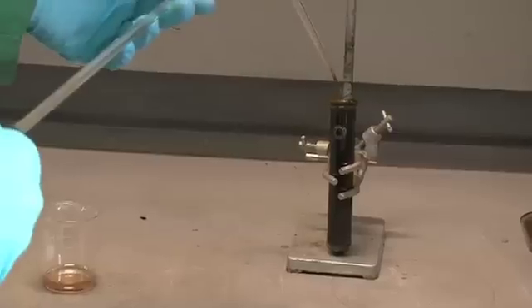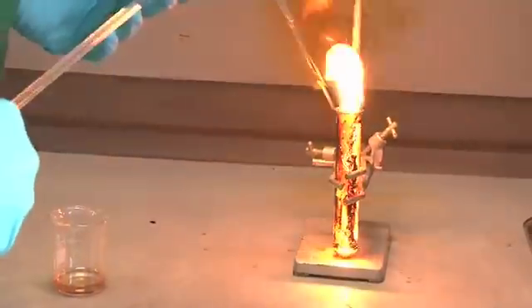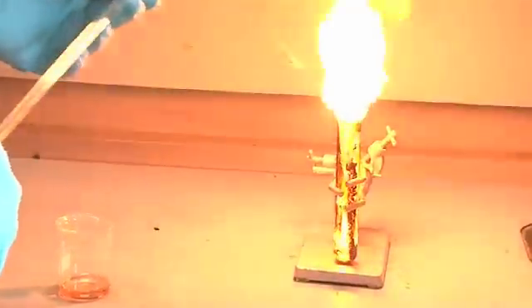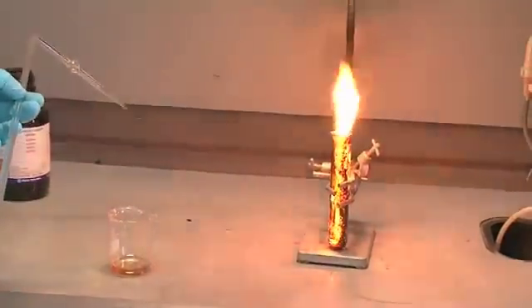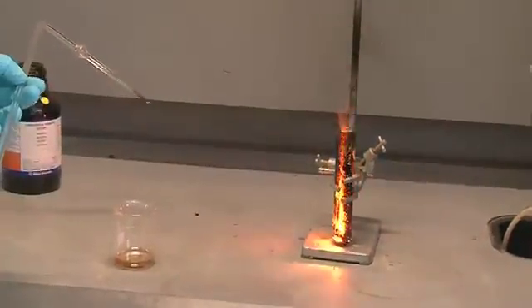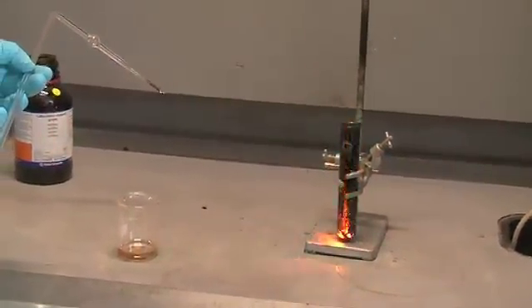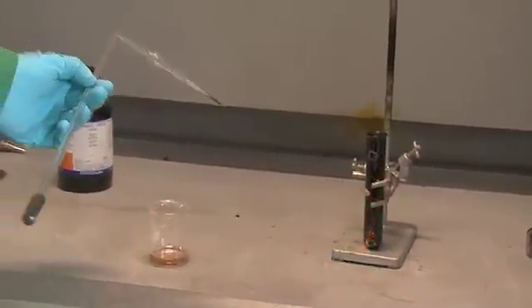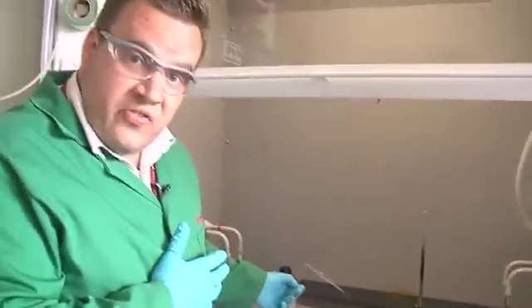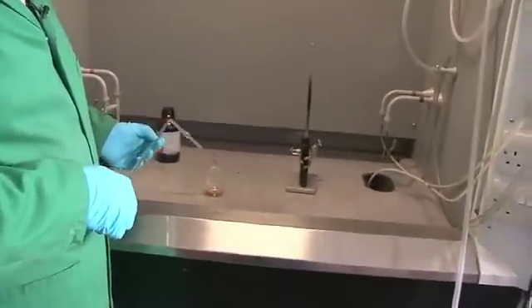I think we should try it a little bit more. Again, the reaction proceeds very nicely — a little bit faster now because the tube is already warm. Let's try for a third.